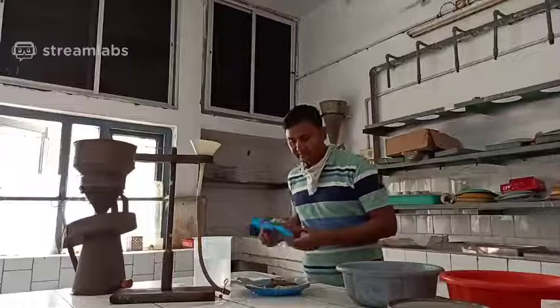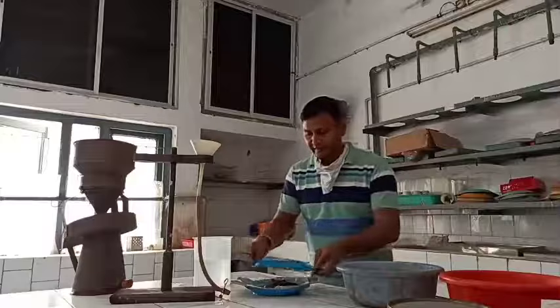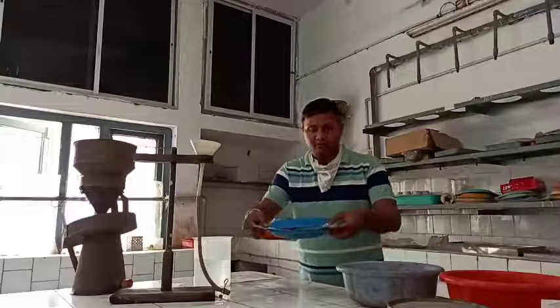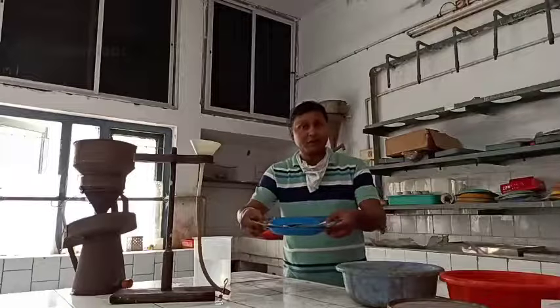Thereafter, cover it and place it. Cover it and place it for 24 hours.